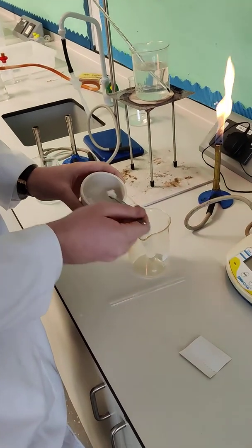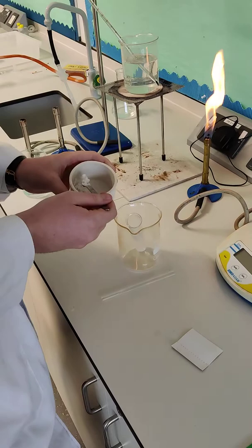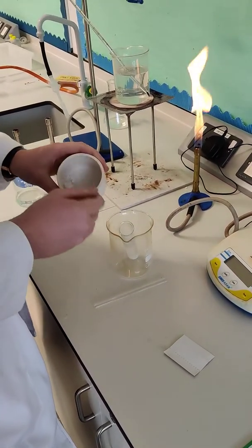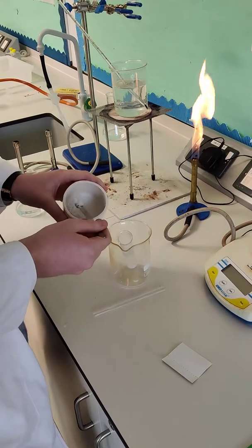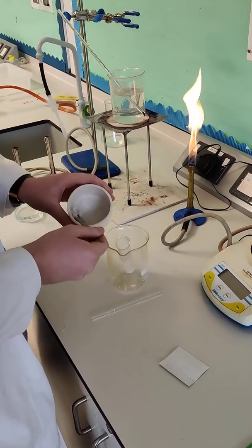What we need to do next is actually heat the ethanol and our crude product mixture. Upon heating, everything will start to dissolve — both the impurities and the aspirin itself. So making sure I get everything in.